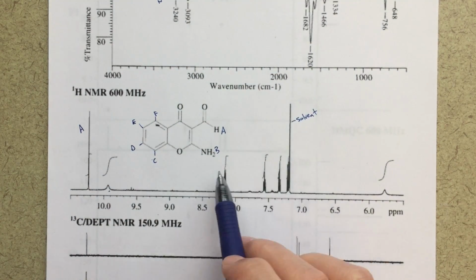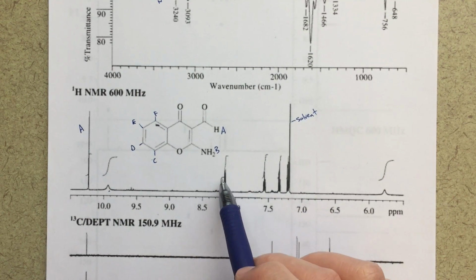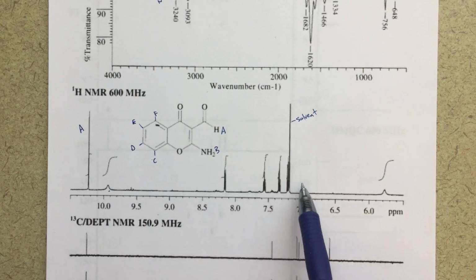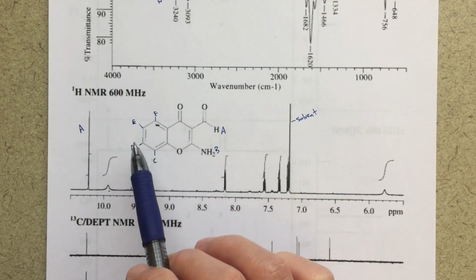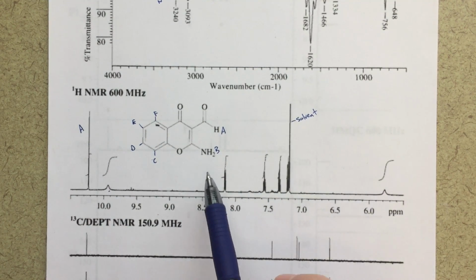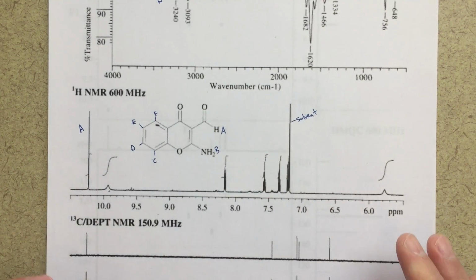So we'll be using these labels as we move forward. Then these aromatic protons, I might have a guess as to which one this one is, but for these ones it's probably a little bit unclear at this point in time. But for now, I'm just going to say that my 4 aromatic protons are going to be C, D, E, and F. That's going to be here. And then we'll talk more about the splitting of the NH2 signal a little bit later on. But that's going to be my labeling for that.